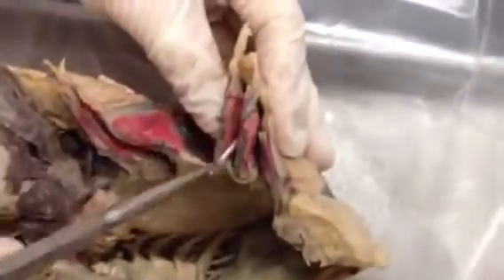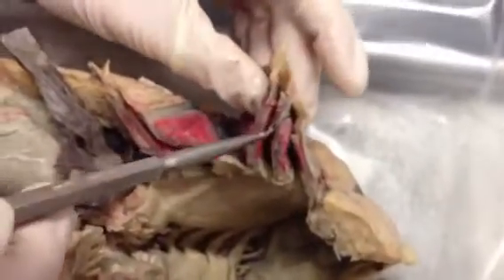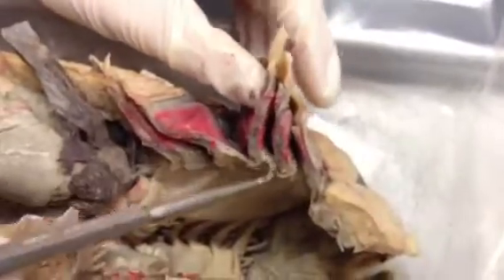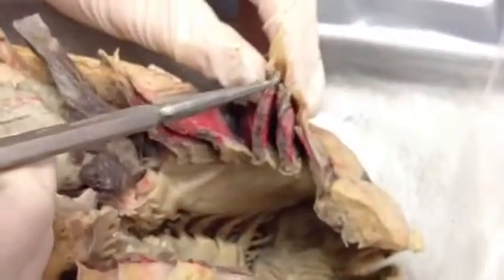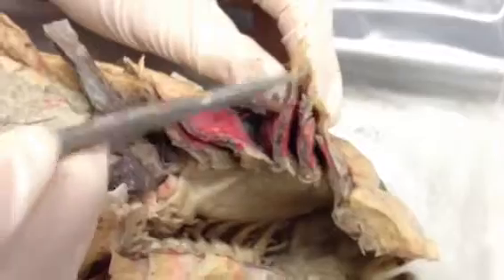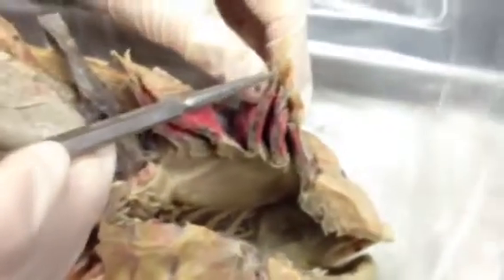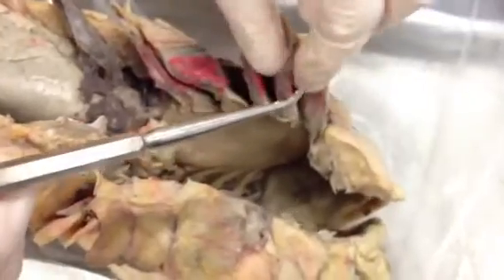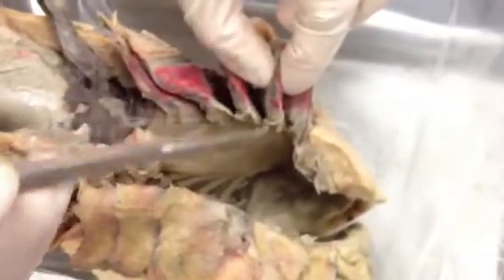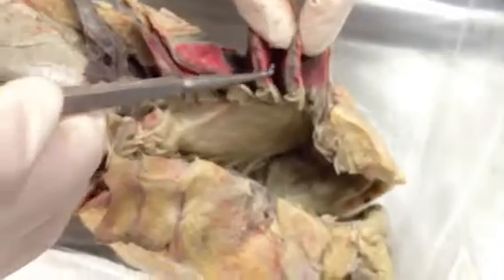And the parabranchial chamber — if you imagine how this gill would be, this part where the lamellae are would be your branchial pouch. And then the parabranchial chamber would be right here, the part that leads to the external gill slit. The interbranchial septum is this entire structure, and it is the septum that separates each branchial pouch.